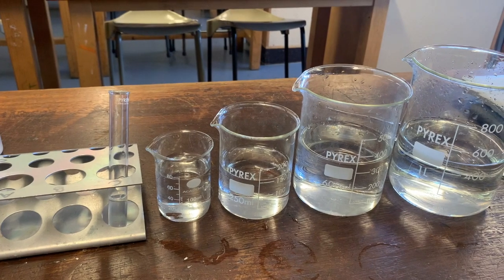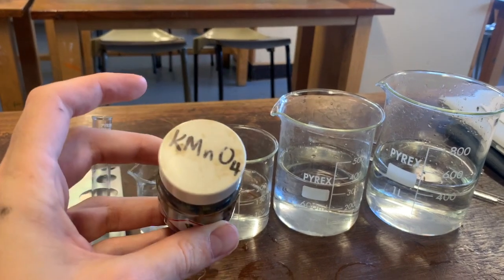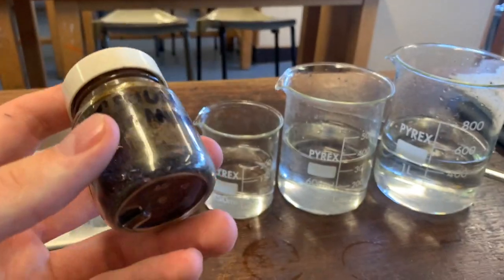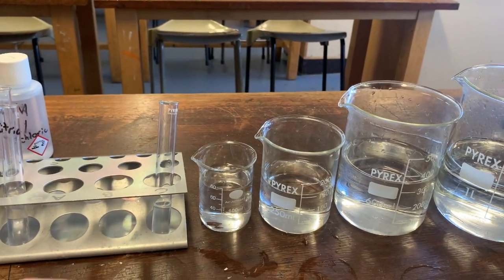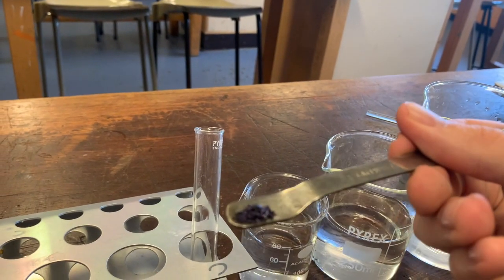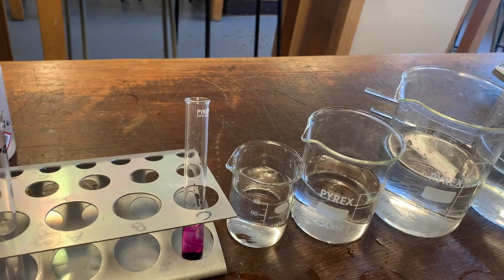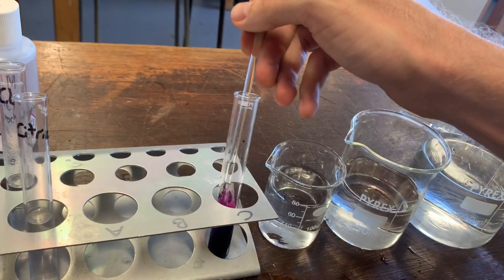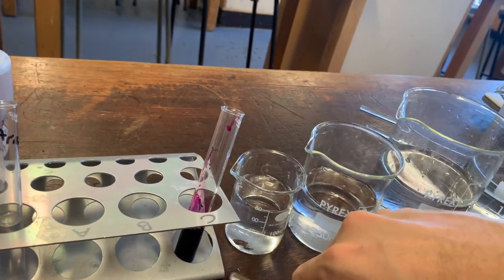I've set this up so you can see what happens when we dilute something. I've got this compound here called potassium permanganate, KMnO4. It's a bright purple substance — you can't really see that as a solid because it's very dark. But when I dissolve it into a little amount of water, you should see a very bright purple colour appear. So I'm going to take just a few crystals of potassium permanganate and put them into the solution. You can see it's making a really nice dark purple — this is what we call a concentrated solution.